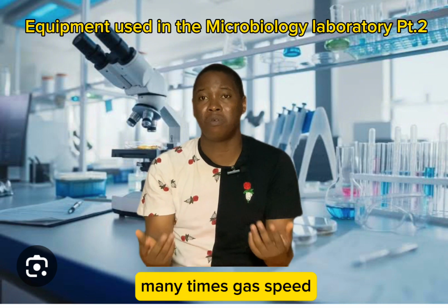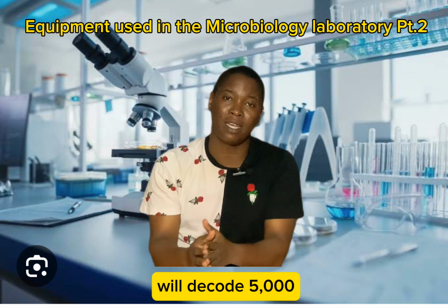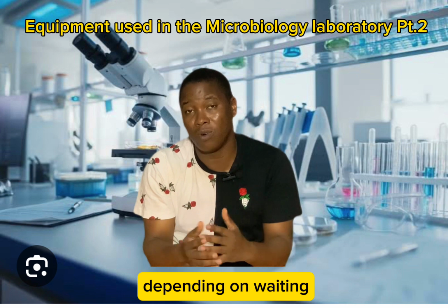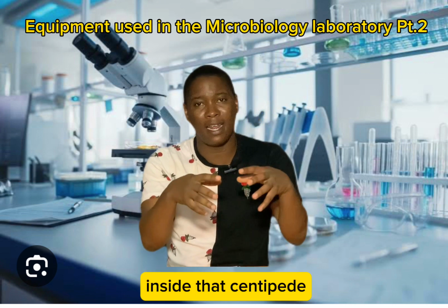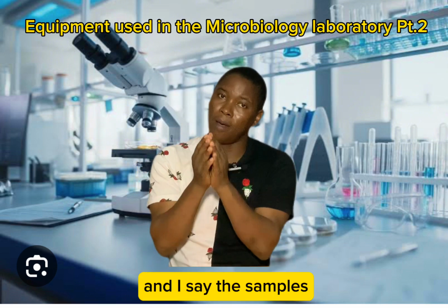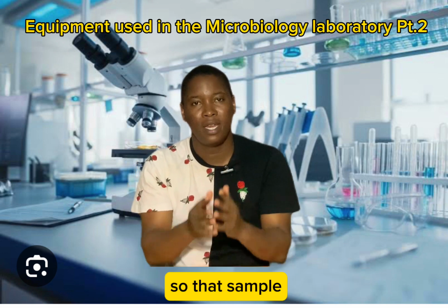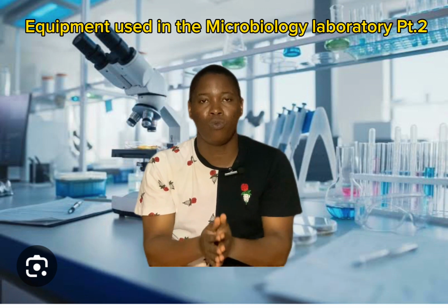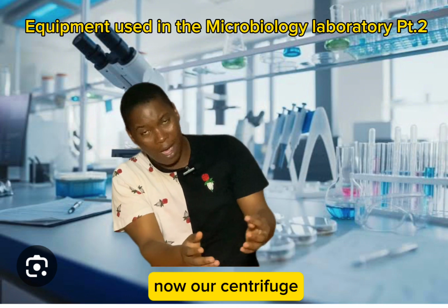Many times get speed wey we dey call 1000 revolutions per minute. Another one dey wey we dey call 5000 revolutions, 10,000 revolutions, depending on wetin the scientist wan do. We will spin those samples very well for inside that centrifuge. If you spin am finish, at the end of the day, the samples wey dey heavier go settle, and the ones wey dey lighter go dey on top. So that sample go don dey divided on the basis of how heavy the different components wey dey inside the sample be. So that one na our centrifuge.